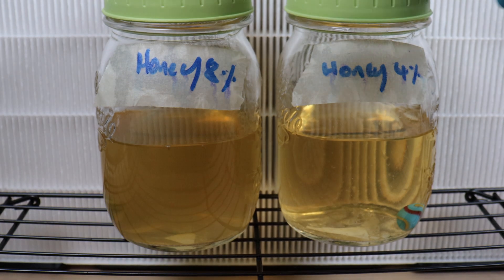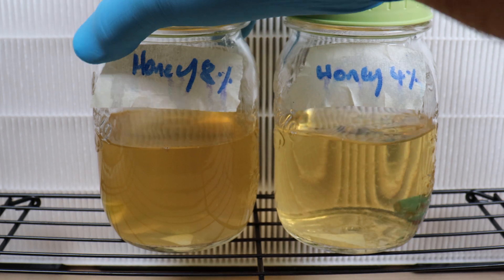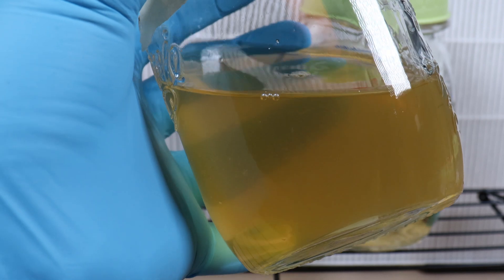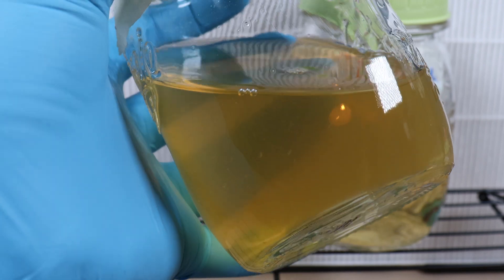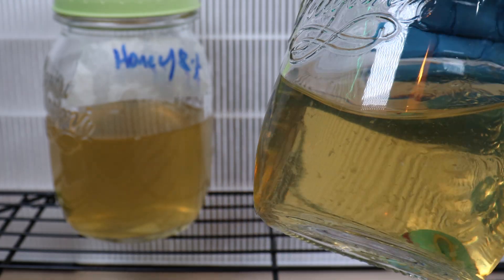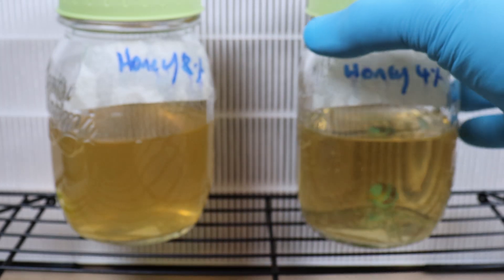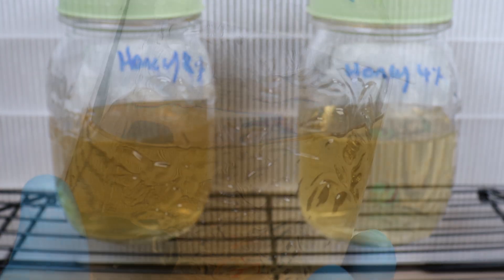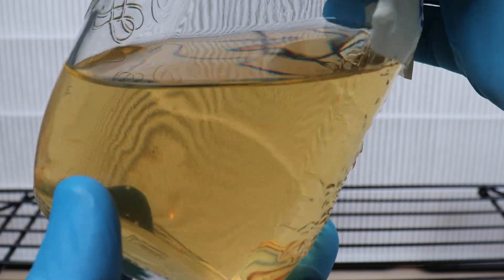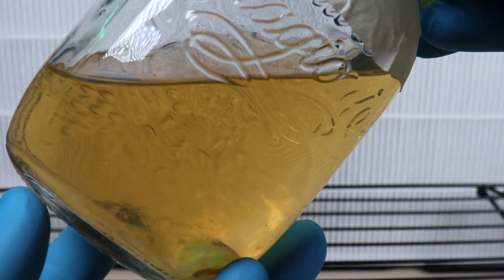I think I've cooked the eight percent there — it looks very caramelised, very cloudy. What a bummer. The rest of the jars look great. You can see the culture I just injected floating around in there, and all the jars have this lovely amber colour. A few proteins floating around in there, but they're all looking very nice.